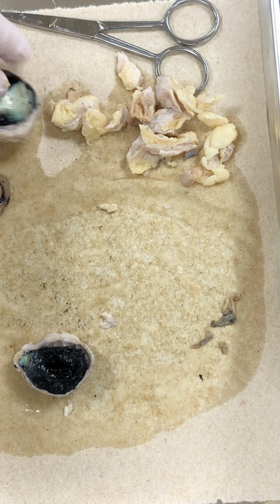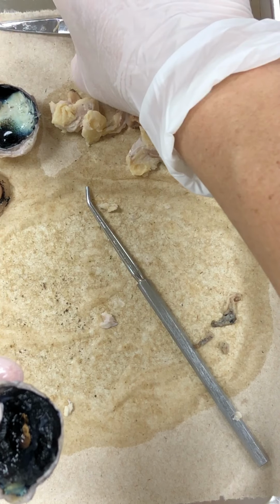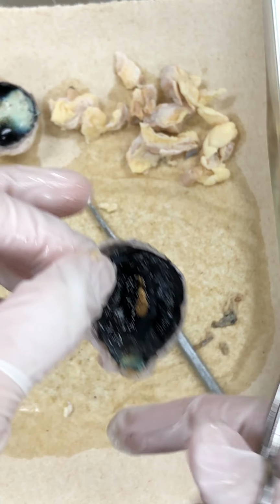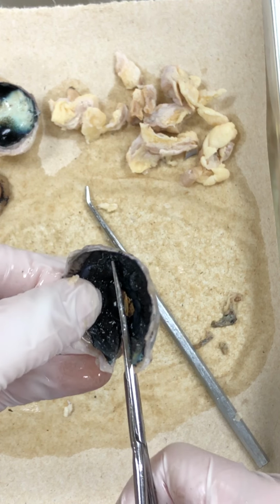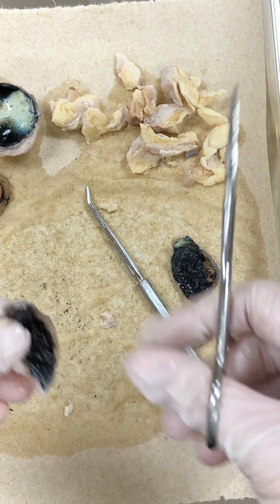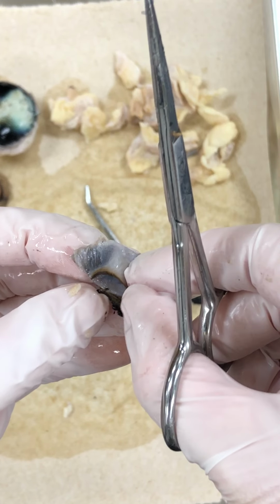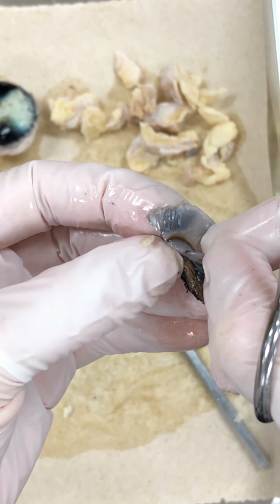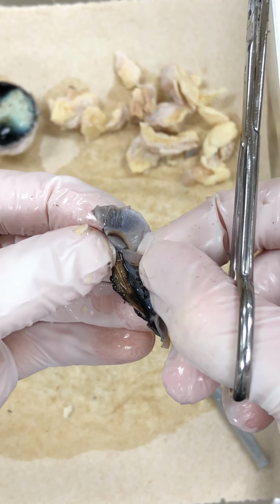Okay, so if we go back to the anterior part, I'm not sure, sometimes you can see the iris and sometimes you can't. It just kind of depends. But if I try to cut through here, and again, the iris is what gives us the color of eyes that we have. Most sheep have brown eyes. And there you can see a little bit of the brown, and that is their eye color, that is the iris.